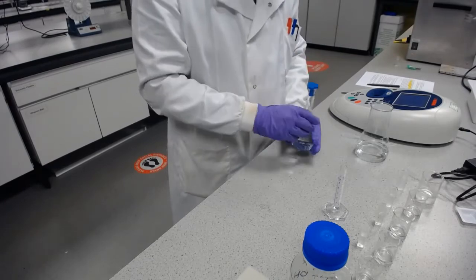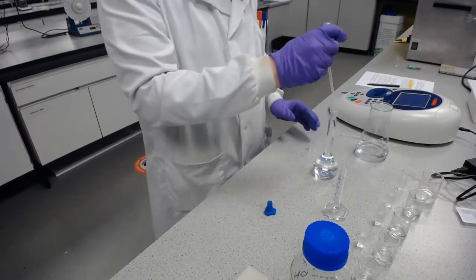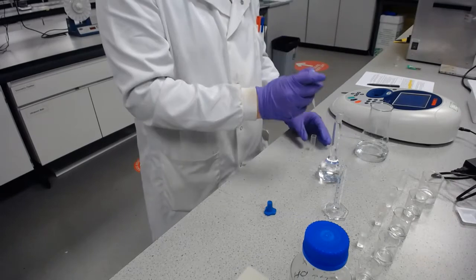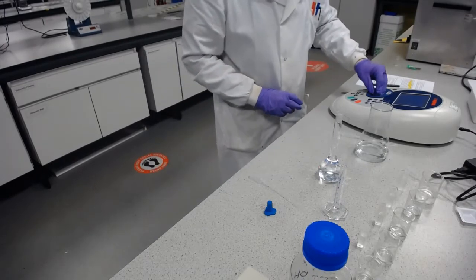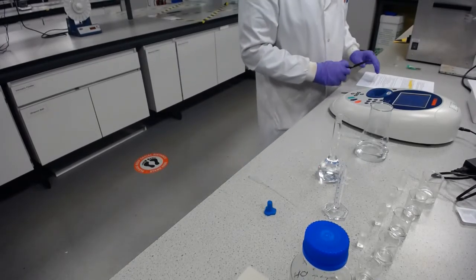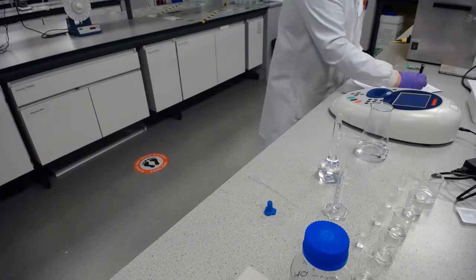We've got our dilute sample, and now we can take a sample from there, and in our already set up and blanked UV vis, take the measurement, which has come out at 0.646, which I'm going to write down.